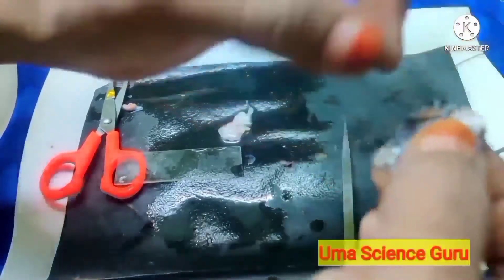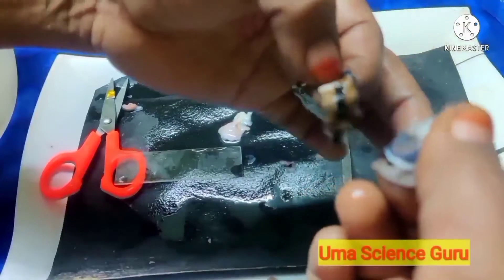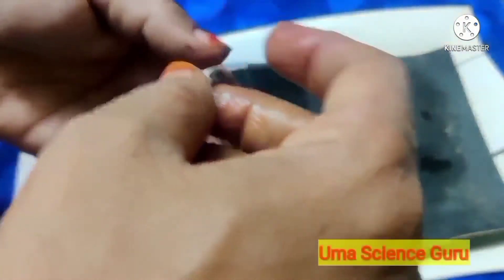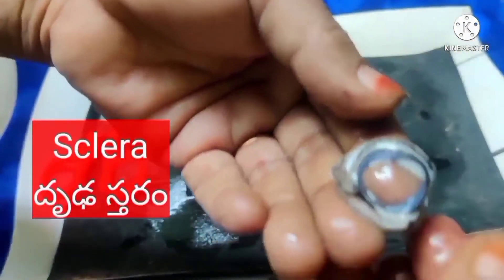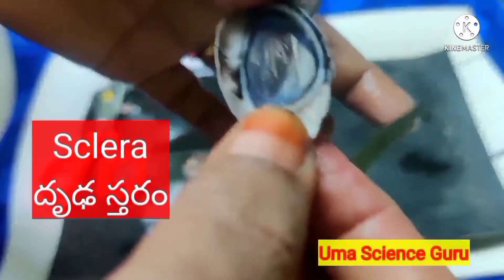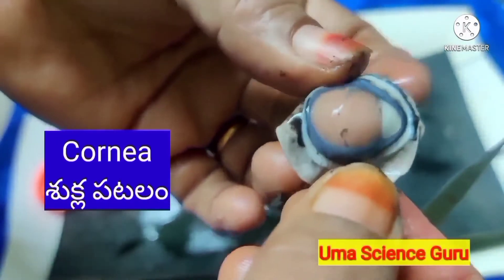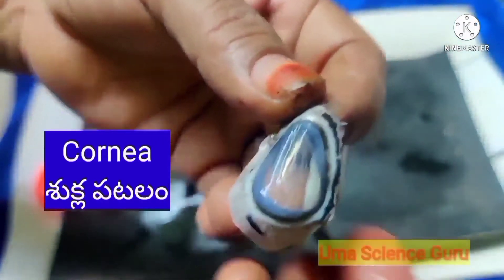Students, observe that both layers are attached together. I have successfully separated the sclera from the choroid layer. This is the choroid layer, and this is the sclera or sclerotic layer — the outermost layer. It is thick, tough, fibrous, non-elastic, and white-colored. The sclera bulges and forms the cornea. Observe the transparent cornea layer.